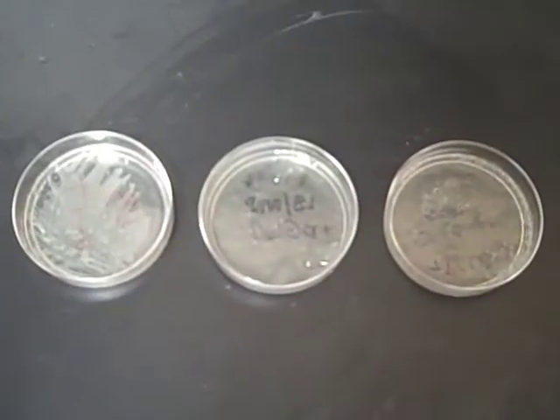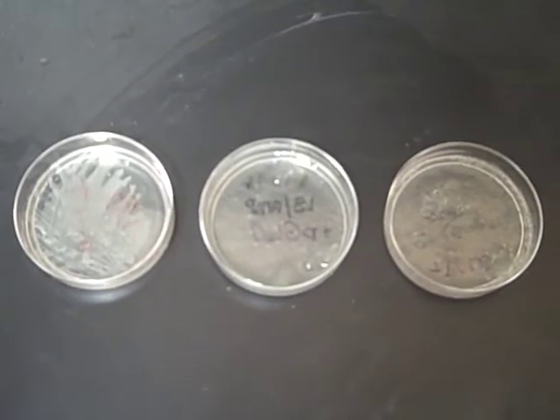So as we're watching the video here of our results, we're going to have 3 plates. The plate all the way to the left on the video is nutrient agar, and that's all that's in the plate, basically just bacteria food and nothing else. So all bacteria should grow on that. Ones that have been genetically altered and normal standard E. coli will grow on there equally well. So everybody grows on that plate.